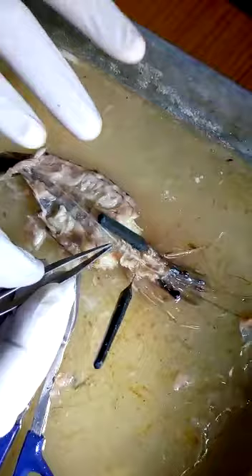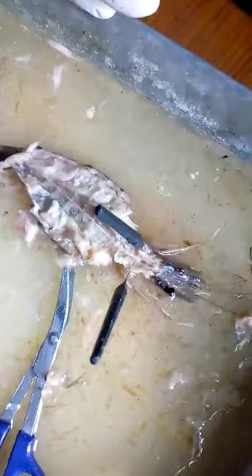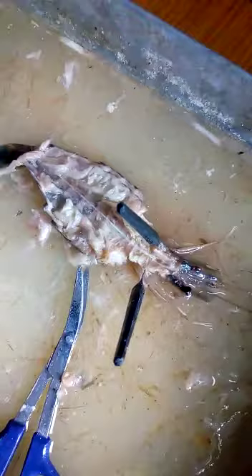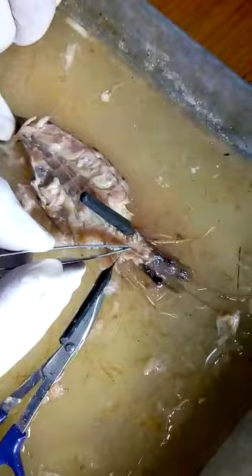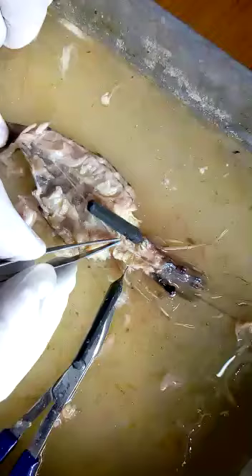The thoracic abdominal ganglionic mass is important, and the aperture is important, and the ventral nerve cord is important, and the ganglionic mass is also important. This completes the nervous system dissection. To recap, the parts are: brain, optic nerve, antennal nerve, the esophageal commissure ring, and the thoracic abdominal ganglionic mass.